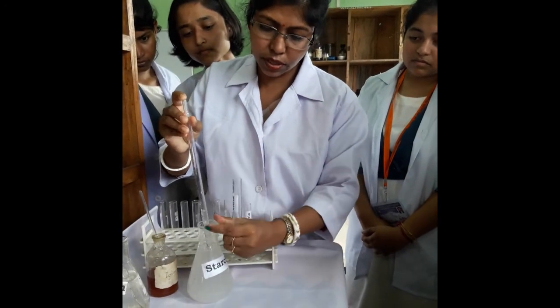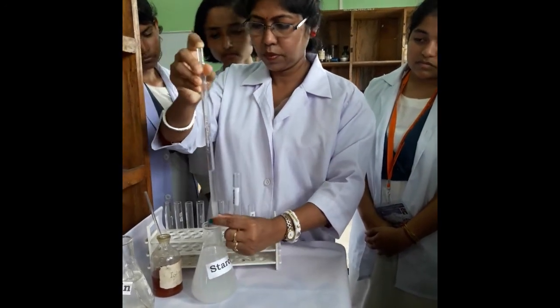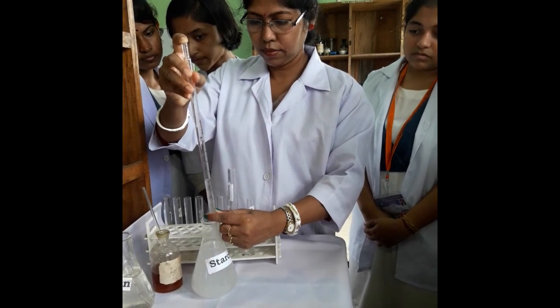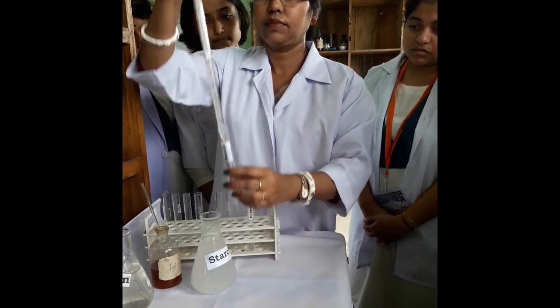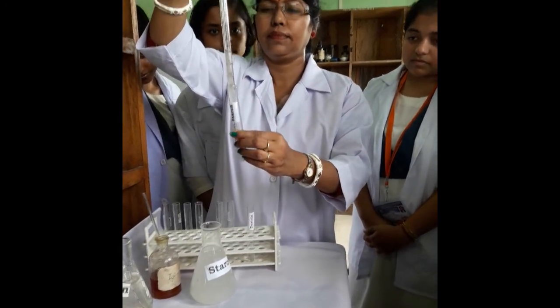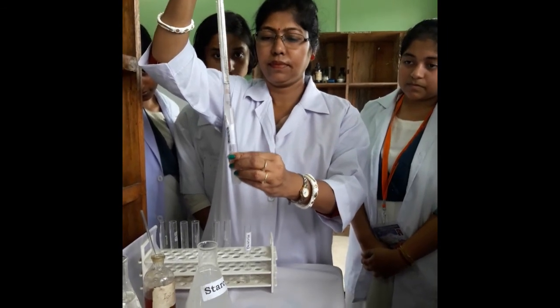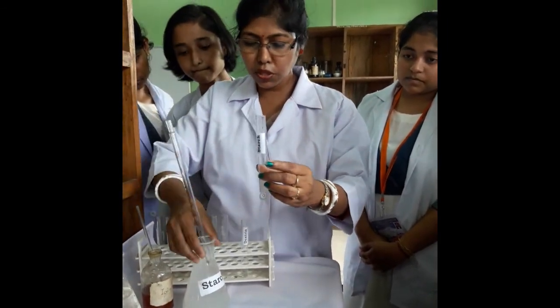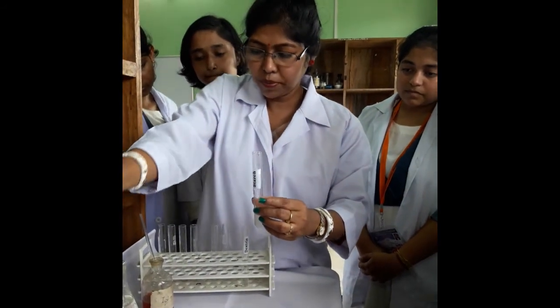This is starch. Three ml of starch solution is taken in this test tube.